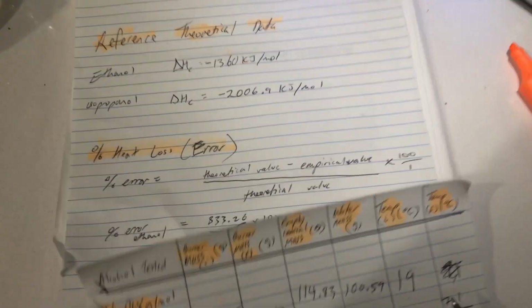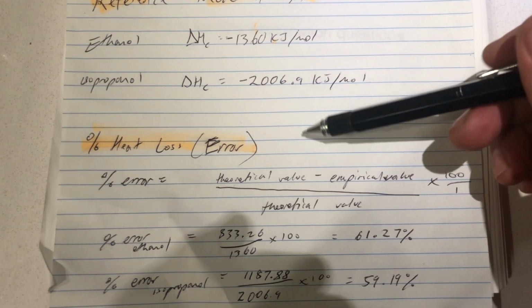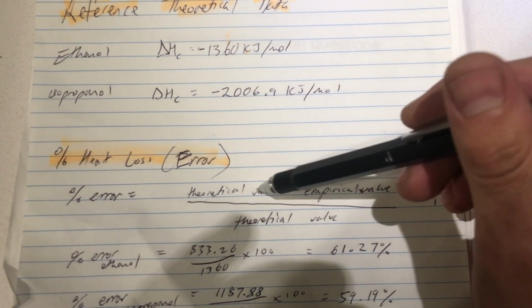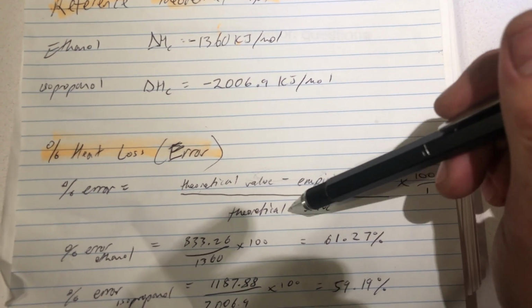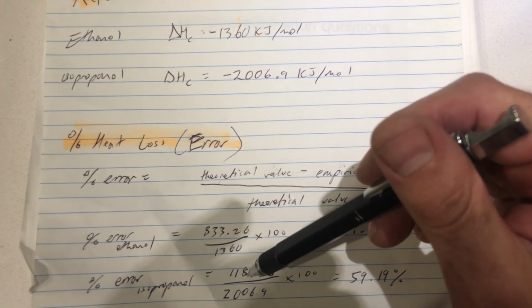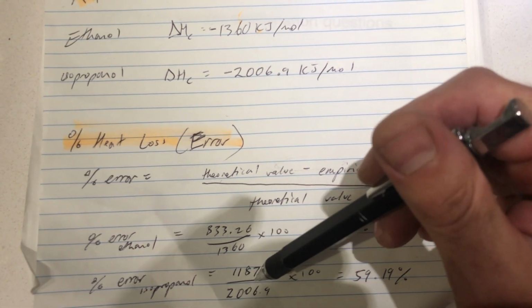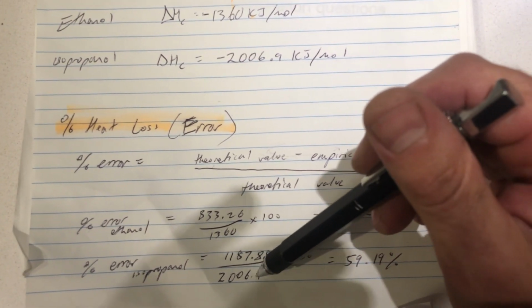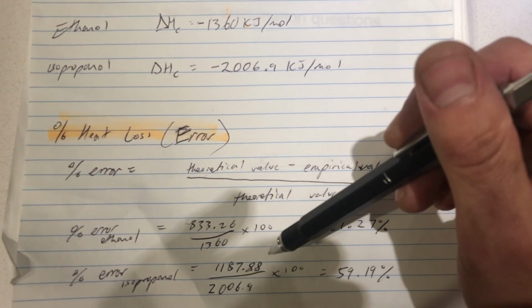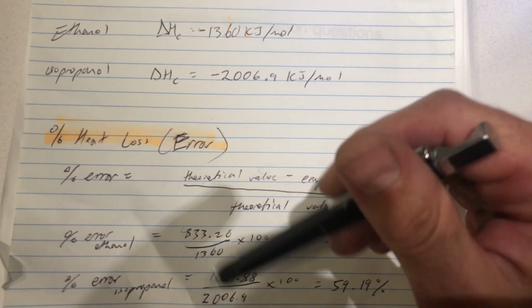So our final step is to compare. We're going to find it nice to do a percentage of error or heat loss. So we find the difference in the values. That's the amount of heat that we did not quantify and measure. That's our loss. We get slightly more heat lost by the isopropanol because it was releasing more heat to begin with, divided by the total amount of energy that we should have been able to capture had we burnt 1 mole. We ignore the negative signs in front, because it wouldn't fit this context. We're just looking at the errors in the value.